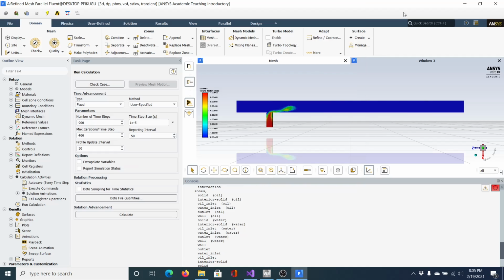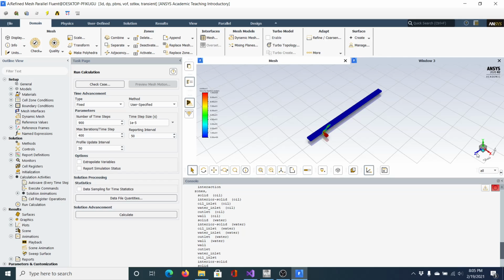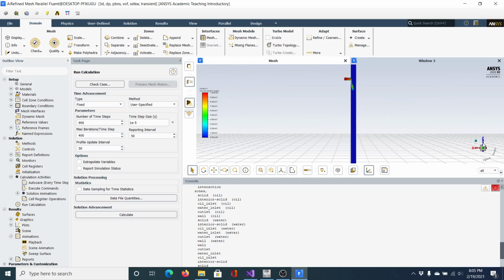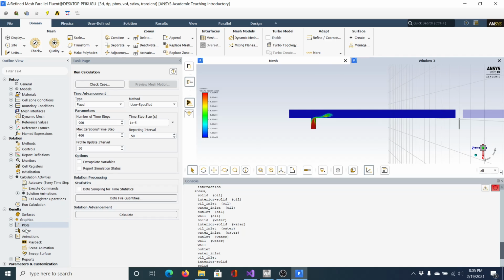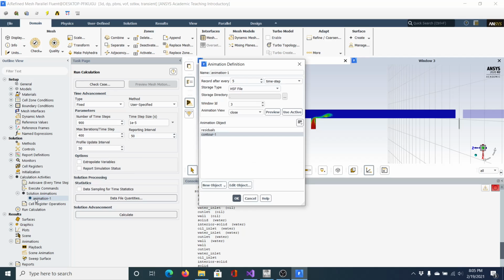Before I do that, I want to show you guys a few settings that I've discovered, I guess, to improve how it looks. When you're running your calculations, you're probably going to be in this display, right? And you want it to be like this, right? So it's pretty simple. When you set up your solution animations, of course you select your contour. It'll probably be an isometric.